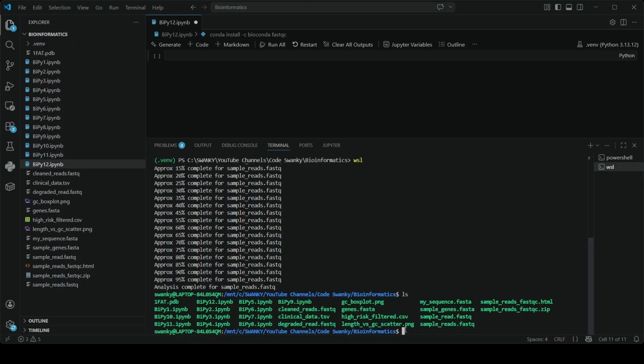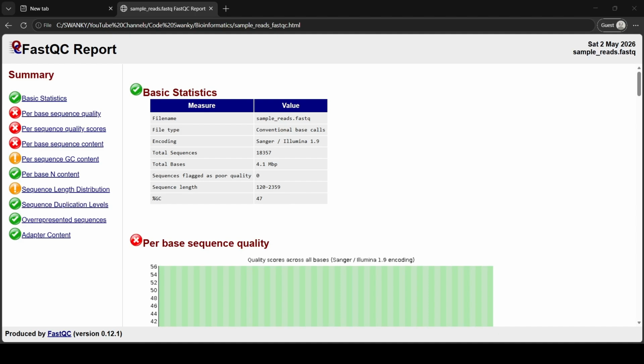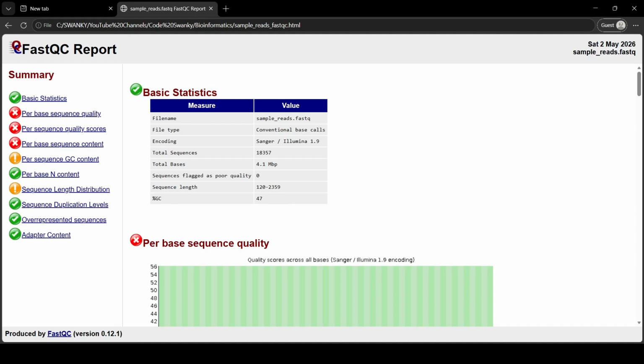So let's try to open that in a browser. I'll show you how it looks. Since it is an HTML file, you don't open it in the terminal or in a text editor. You open it in your web browser like Chrome or Firefox. In VS Code, you can usually just right click the HTML file in your Explorer panel and select open in default browser. I have opened it in Edge for your understanding.